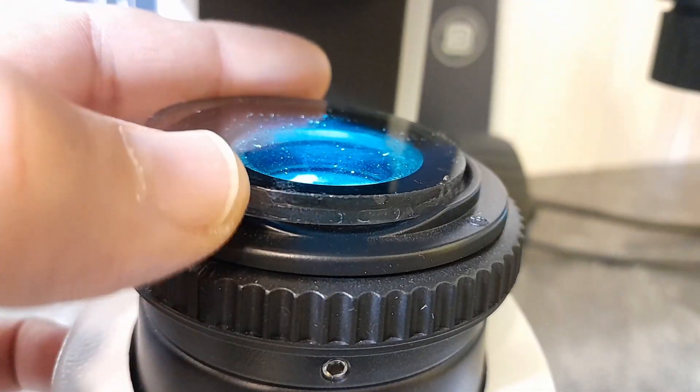Look what I can do when I turn one of the polarization filters here. Yeah, the colors change around quite nicely. And in this video today I would like to show you how you can also grow those citric acid crystals yourself.